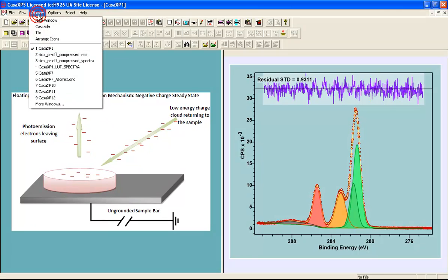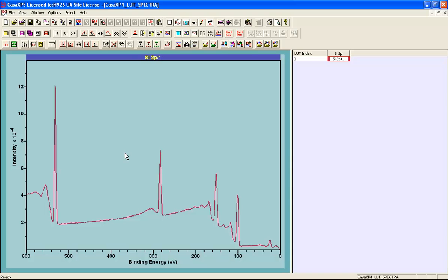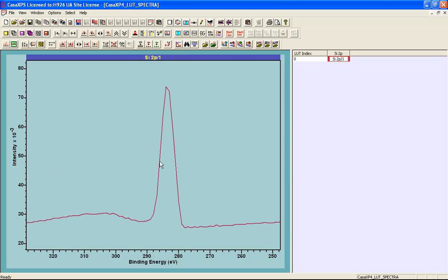When presented with a sample, the first measurement that is performed is typically that of a survey measurement. And the survey measurement from this silicon oxide suggests that we have oxygen, carbon, and silicon. And so we might expect this to be a reasonable XPS measurement until we look a little bit closer. And then we see that the peak here, that is a carbon peak, is about 5 eV wide, which is too wide for the resolution of the instrument.